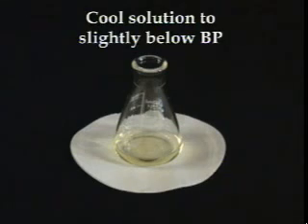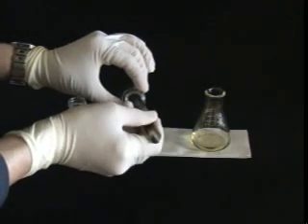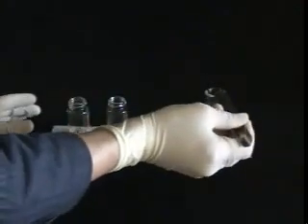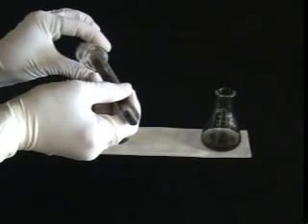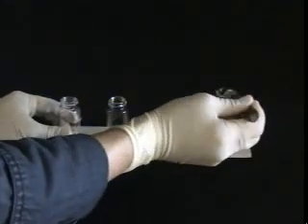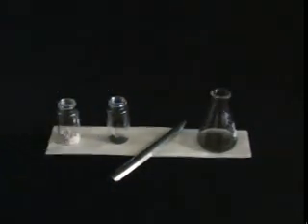Before adding any charcoal, cool your solution to slightly below the boiling point. Caution! Adding charcoal to a boiling solution will cause it to boil over. Add a small amount of charcoal to absorb the impurity — do not add too much or the charcoal will also absorb your compound. Swirl the flask and boil it in the water bath for two to three minutes. Charcoal is very fine and can be hard to remove by filtration. It is easiest to add a small amount of a filtering agent, such as Celite, to absorb the charcoal and facilitate the filtration. Add only a small amount, swirl the flask, and heat it once again for two to three minutes before performing a hot filtration.